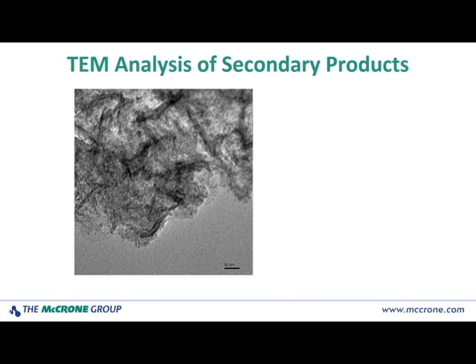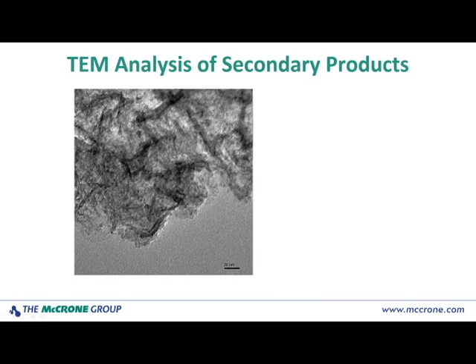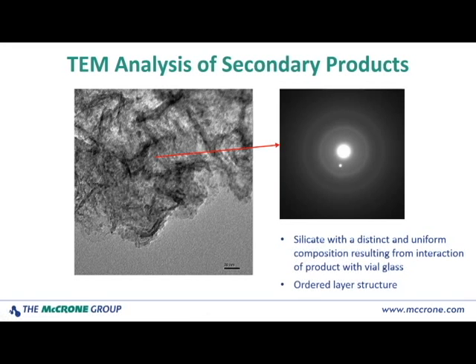And this is a similar sort of product. Let me go back to the low magnification image. You see that this image has a lot of texture in it. It looks like something other than glass delamination. Looking at it at higher magnification, you can see that there are areas where there are bands of light and dark contrast. These are showing you the edges of a layered or somewhat ordered structure that's formed. That's reflected in the electron diffraction pattern, which shows two faint rings, which are evidence of this sort of large-scale ordering or layering of the structure. And this analyzed as a silicate with a distinct and uniform composition resulting from reaction of the product with the vial glass, and it did have an ordered layered structure. So again, something beyond glass delamination and now actually reaction of your product with the glass container to form secondary materials.